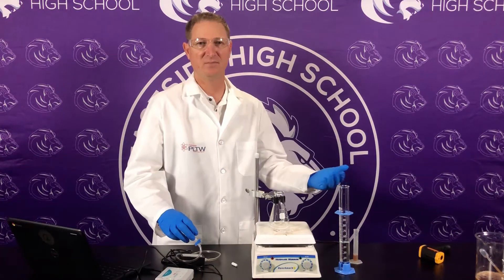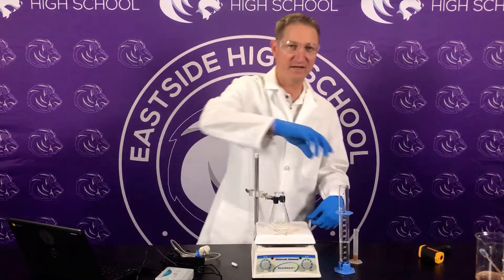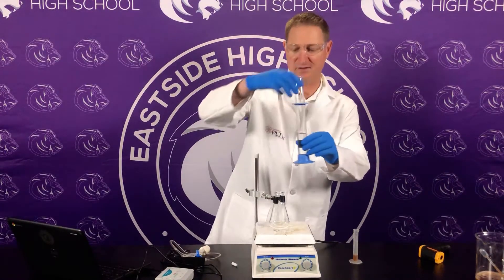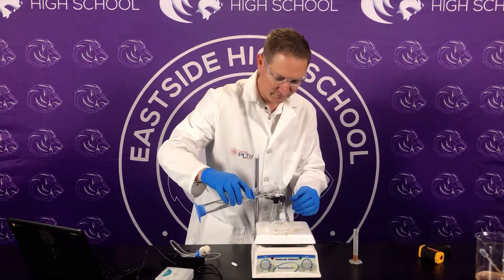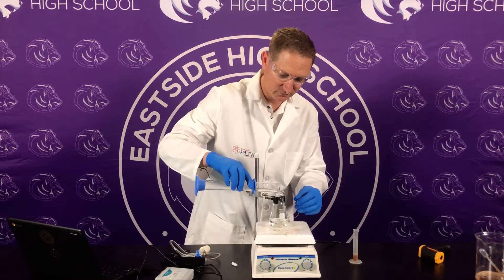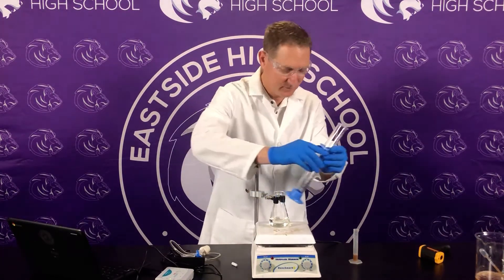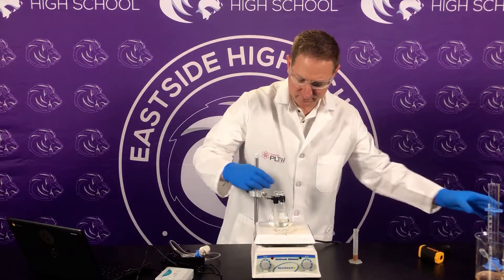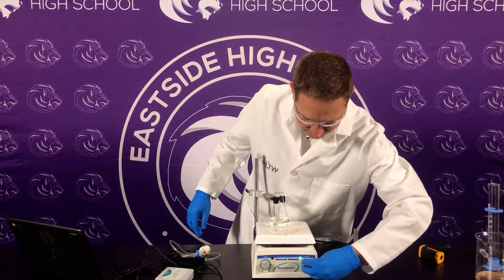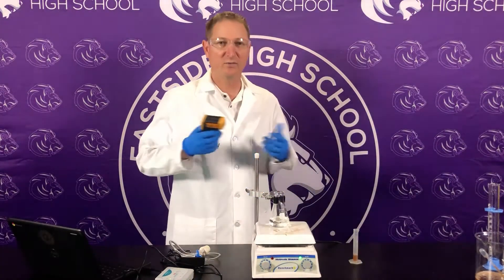We're going to look at the rate of reaction depending on the temperature of the hydrogen peroxide. The original H₂O₂ was at 20.3°C. We're going to pour this in — this is the cooler of the two — and we'll do a warm one as well. We'll put the stir bar in just like in the baseline and take the stirrer to five. This is where we have our change.